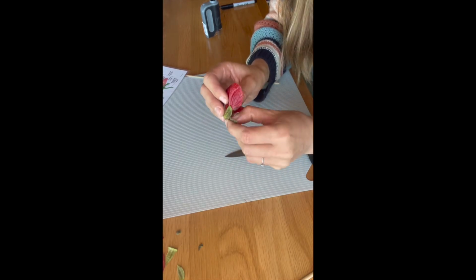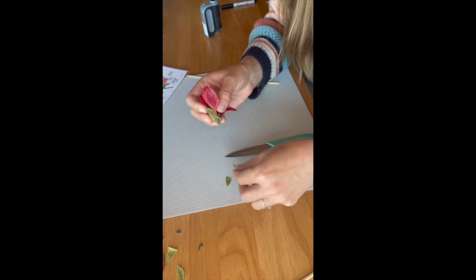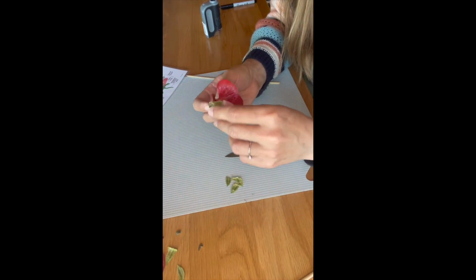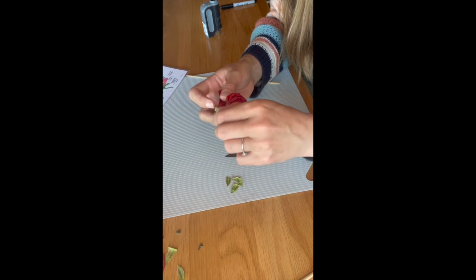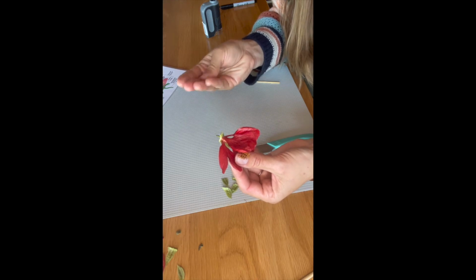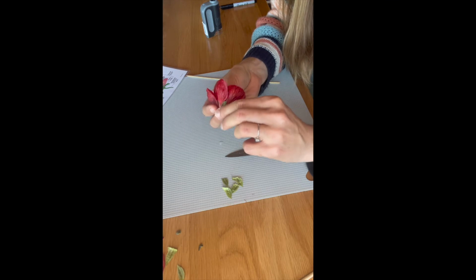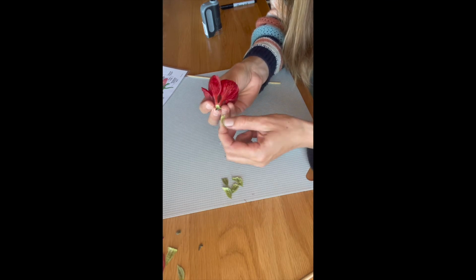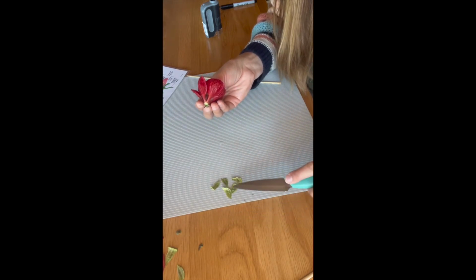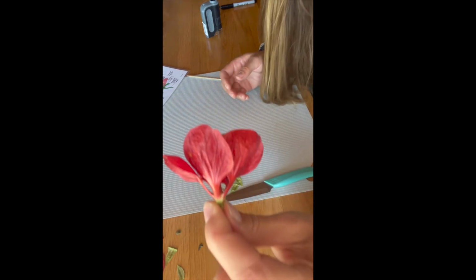We're going to count them as we go. I've got 1, 2, 3, 4. Oh my gosh, and as I'm doing this, this liquid is coming out of the flower, which is really cool. It's full of water and liquid. 5. So we've got 5 sepals. 1, 2, 3, 4, 5. And now we're looking at just the petals.